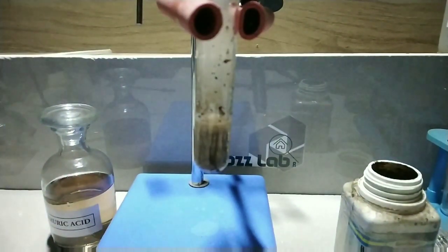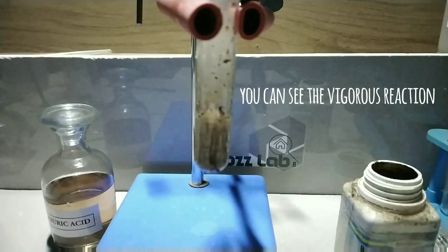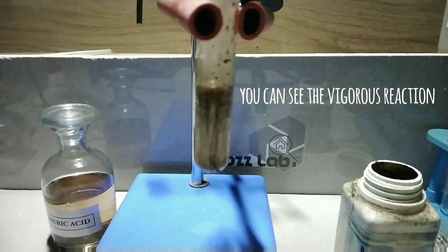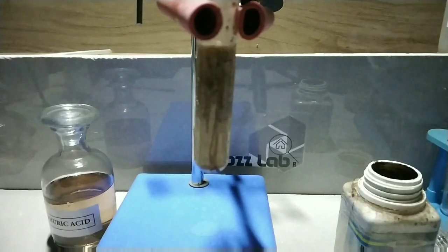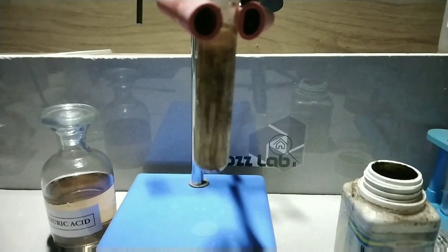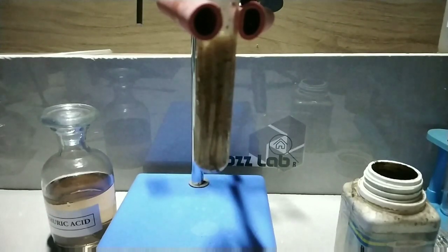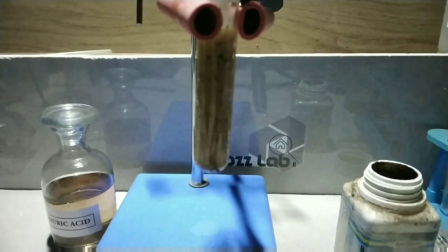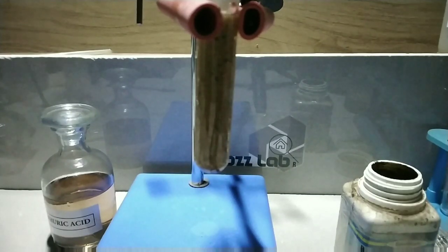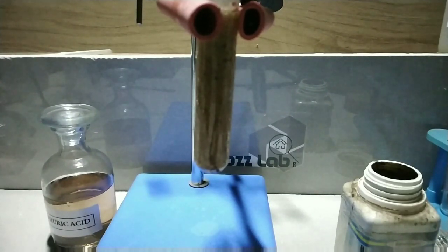You can see that this reaction is very vigorous — the products in the test tube are actually rising up, too much fume is also being produced, and you can also see flashes of light. That means not all the potassium permanganate has reacted with the sulfuric acid and the reaction is still going on.